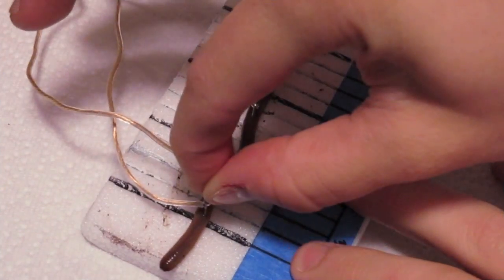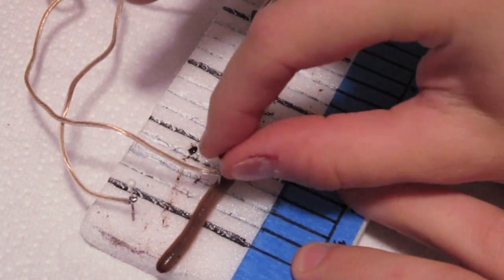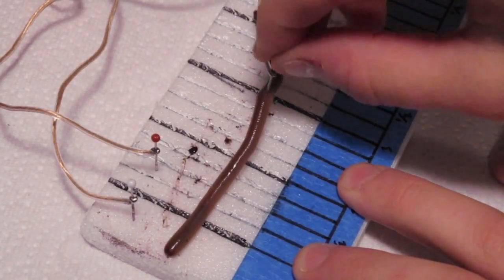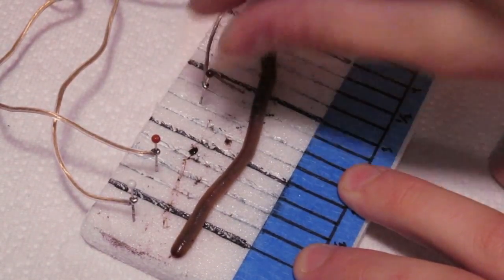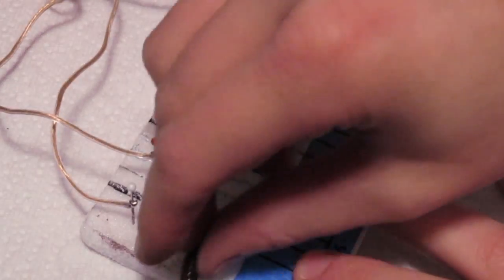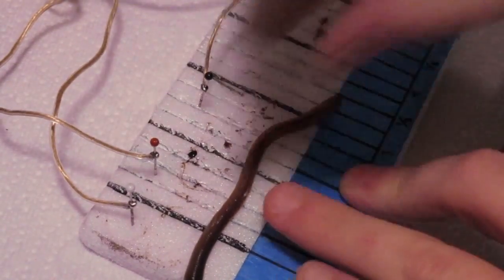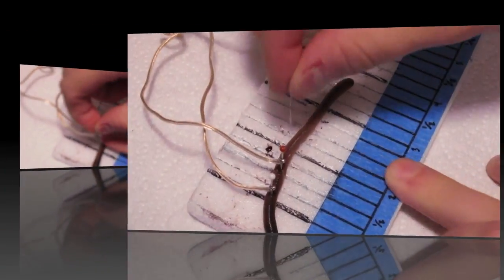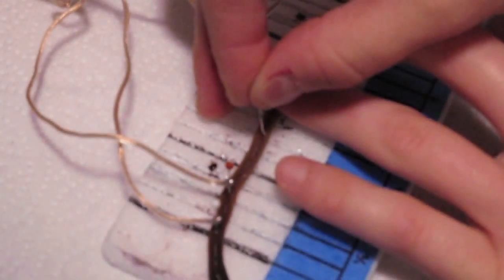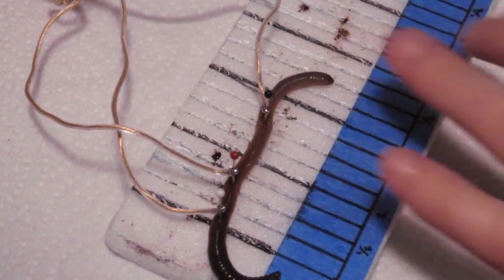Now that you have turned off the spiker box, remove the worm from the Faraday cage and take out electrodes 1 and 2 and the ground. Next, spin the worm around 180 degrees. Ensure the dorsal or dark side of the worm continues to face up towards you. Finally, you'll replace the 3 electrodes. Electrode 1 will be at the anterior end of the worm, and the ground electrode will be at the worm's posterior end.